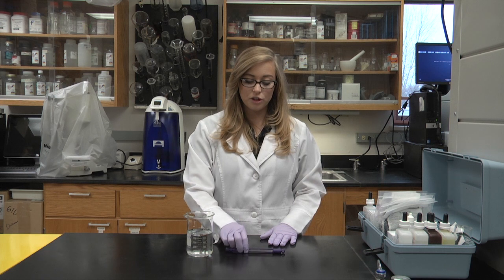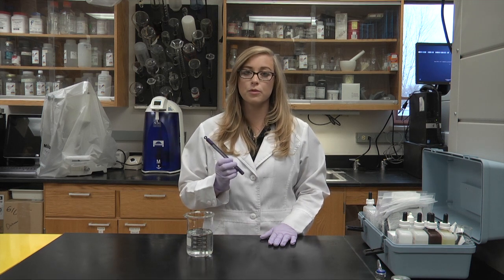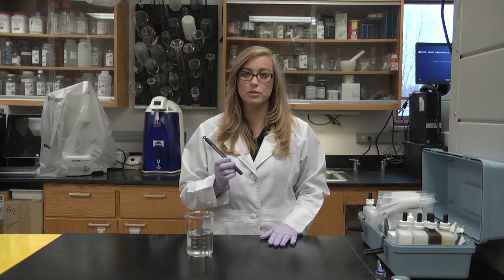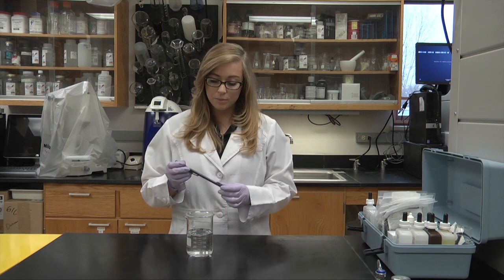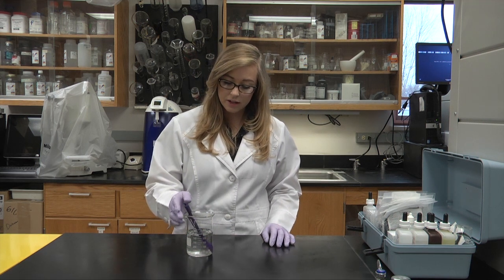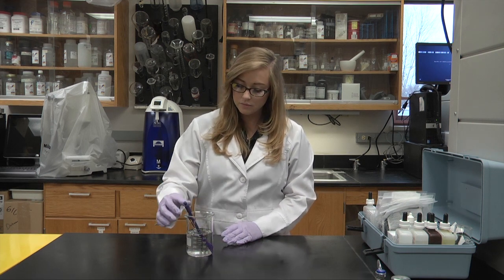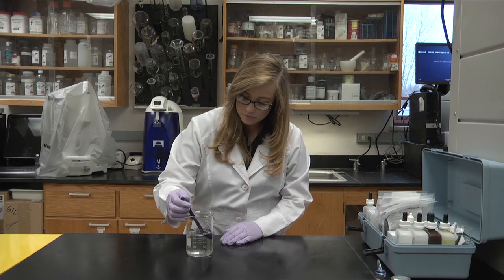We are now going to test for temperature. We're using a mercury thermometer, so please be careful with this. And if it does break, dispose of it properly. So for this, we have our water sample. And we'll just place it in here. And as soon as we get a stable reading, that will be the temperature. So in this case, it reads about 18 degrees Celsius.